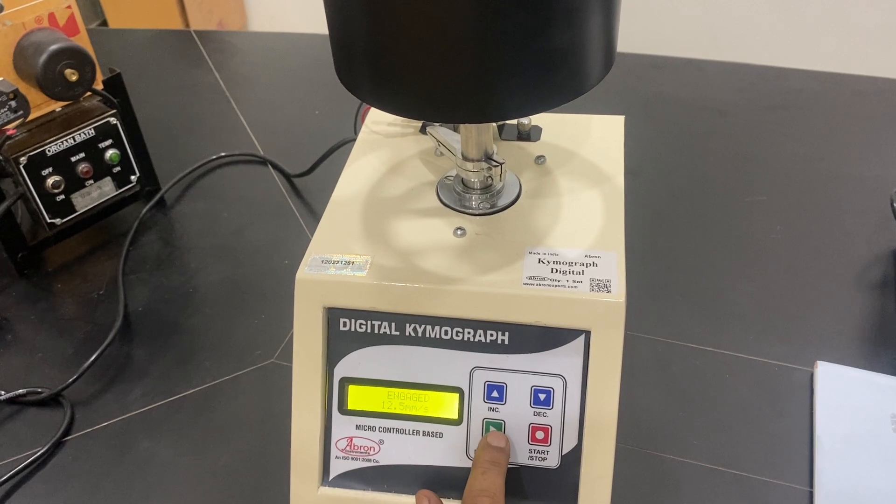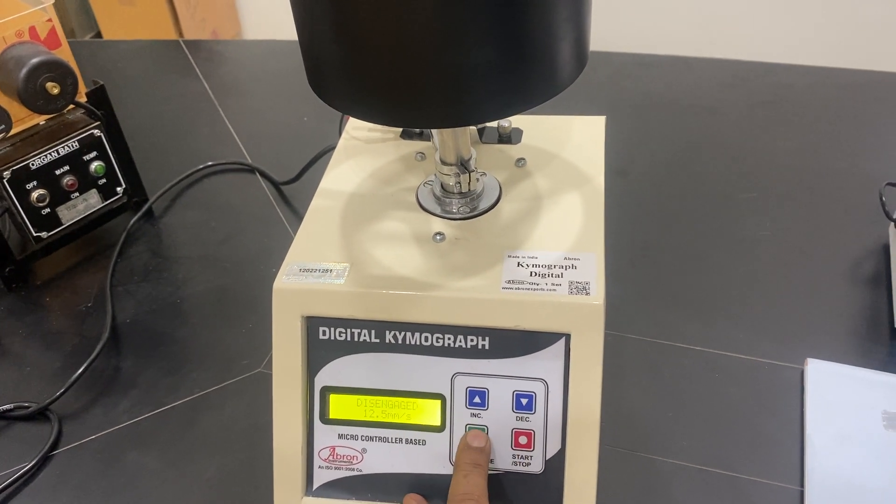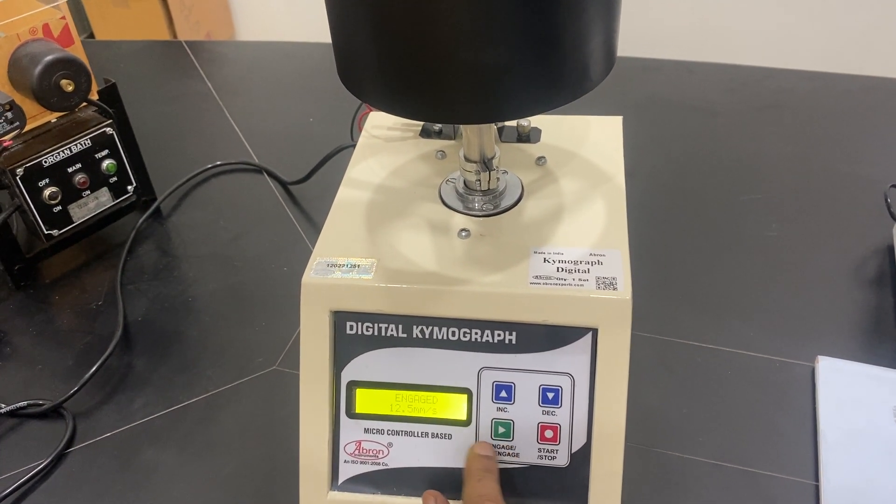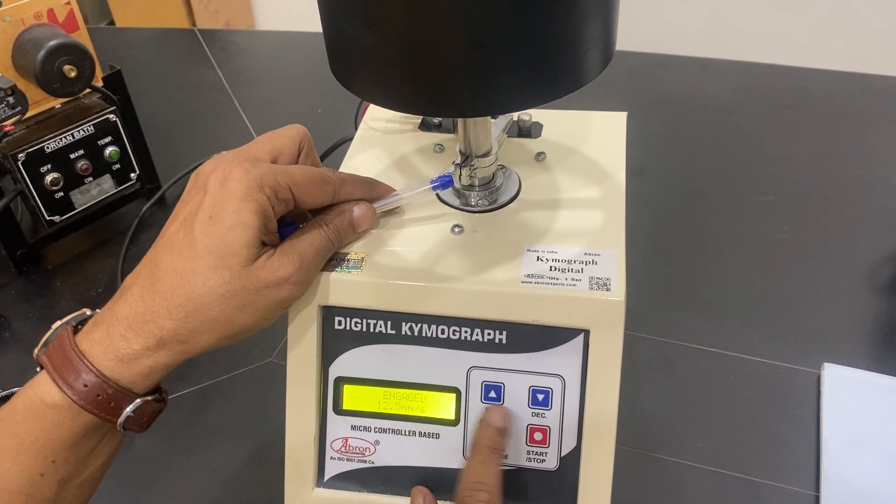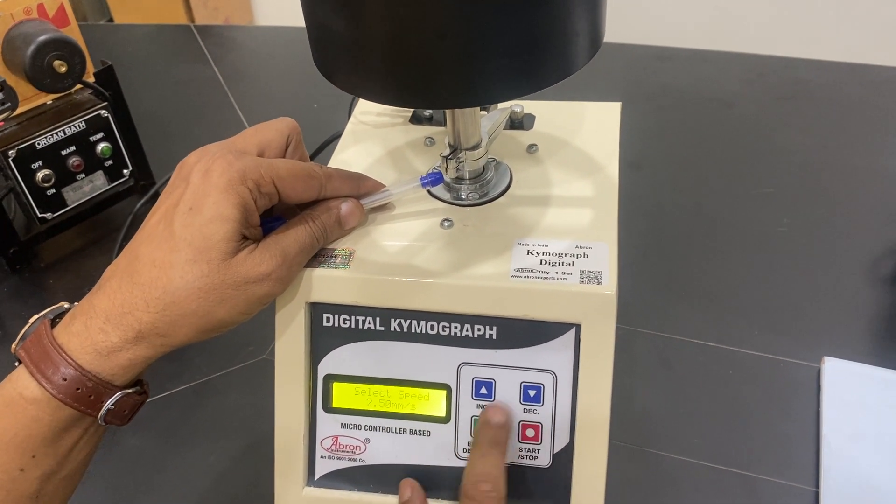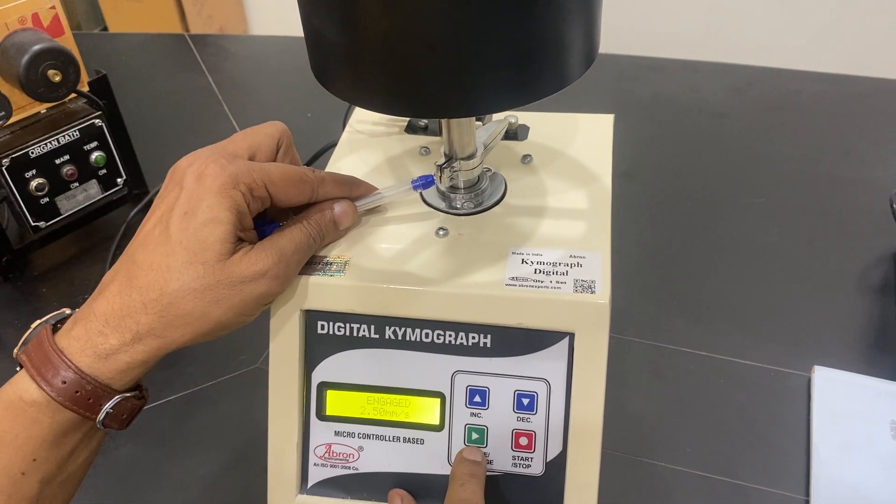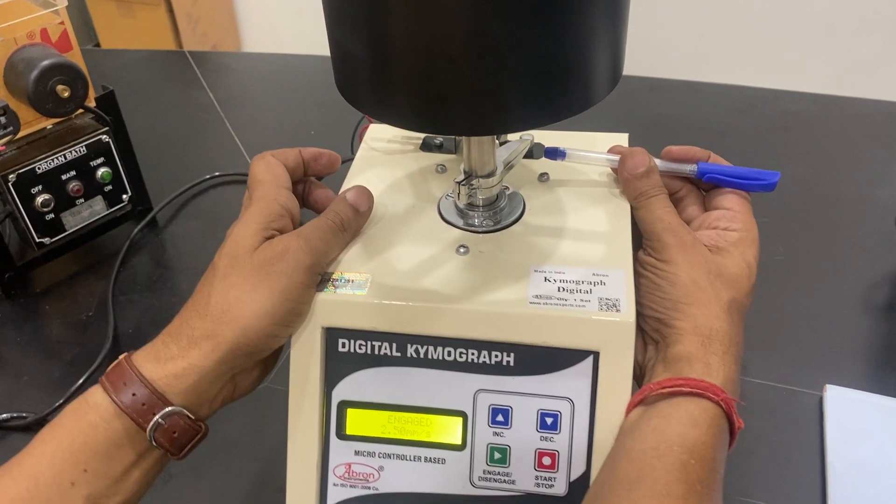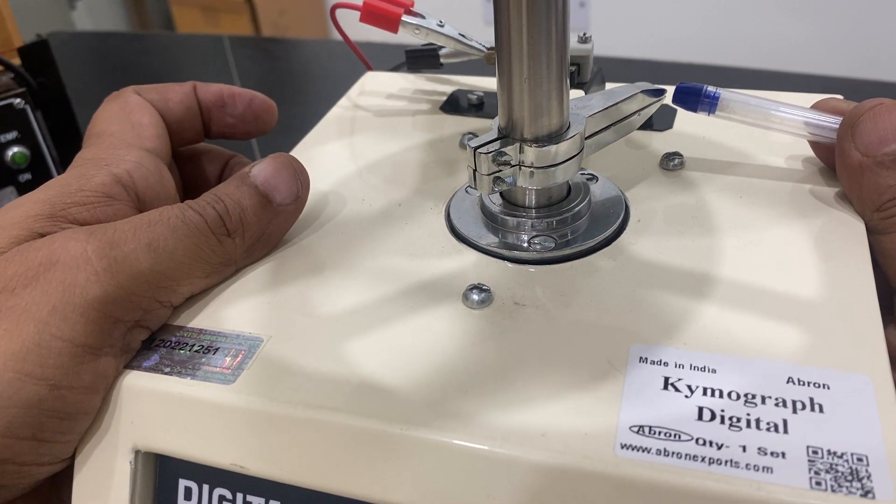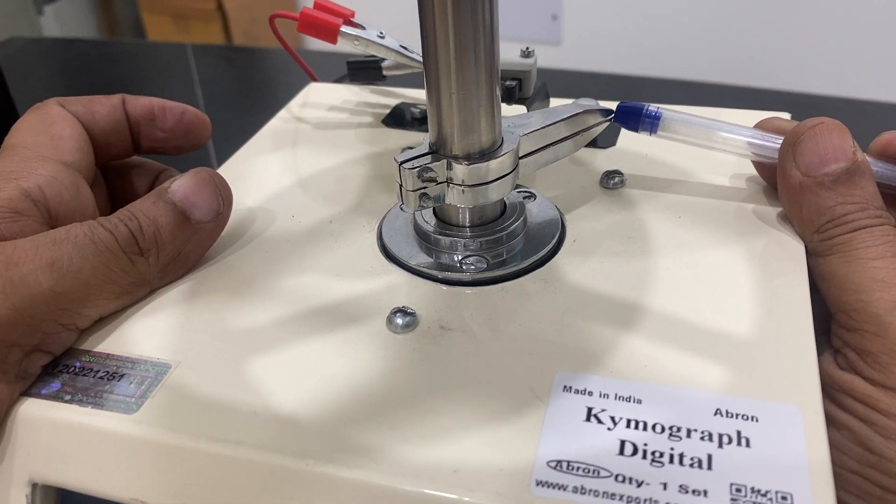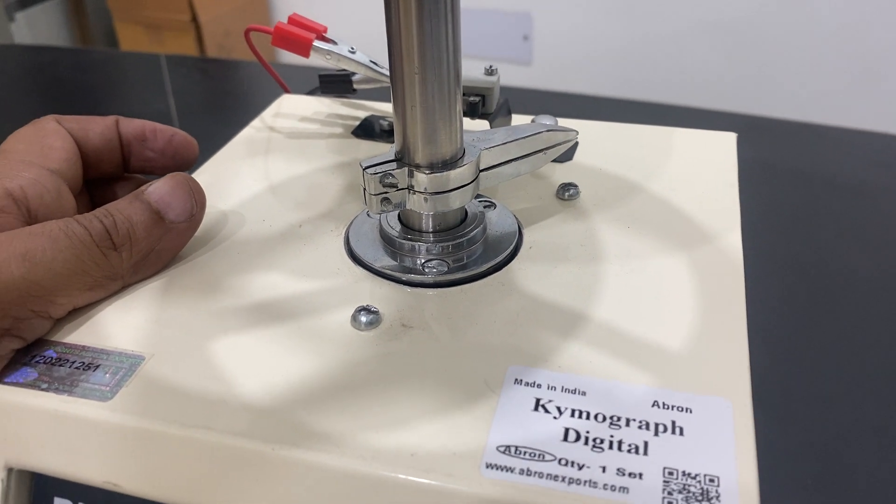12.5 mm, slowly going much lower. 12.5 mm, you can still see there is a movement. I can just show you again, decreasing it very slowly. You can see there is a movement. Now you see it's coming close and now it will pass, it is passing.